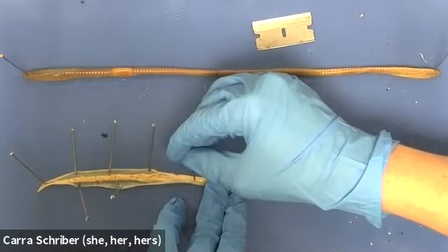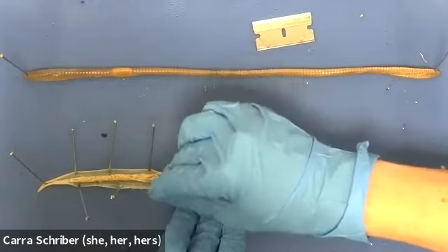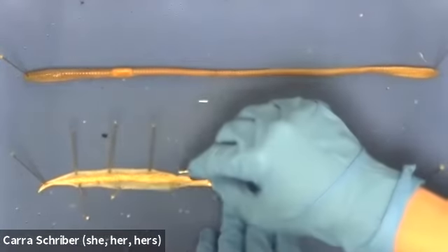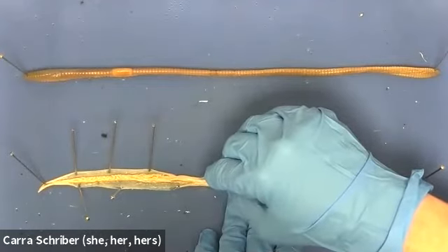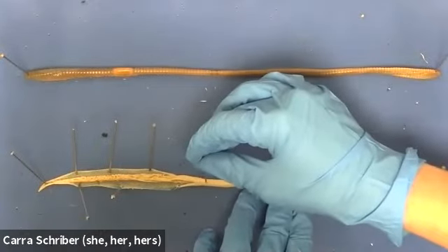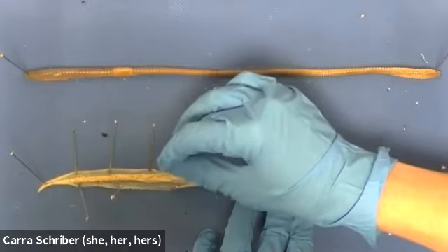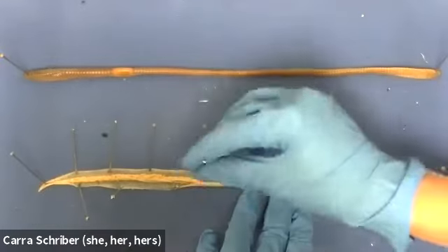So when we're doing a dissection, especially with something as small and thin as this, the real hard part is actually just not piercing the organs, right? Just keeping it surface level and only peeling away that skin layer. So if I cut really deep into this roundworm, I would cut through the organs as well. And we want to keep the organs intact because that's what we're actually trying to open this thing up to look at. So a little bit of technique involved here.